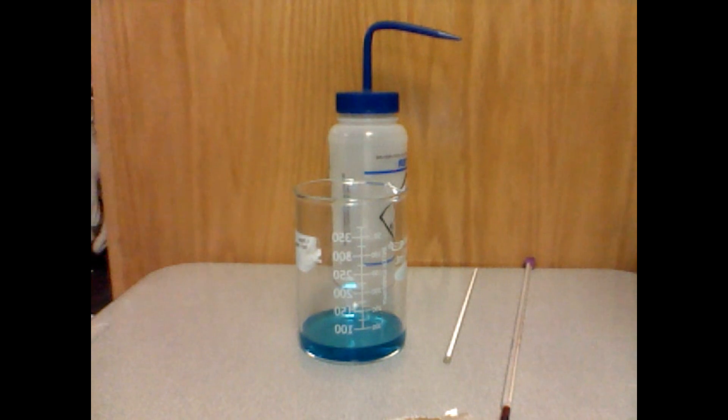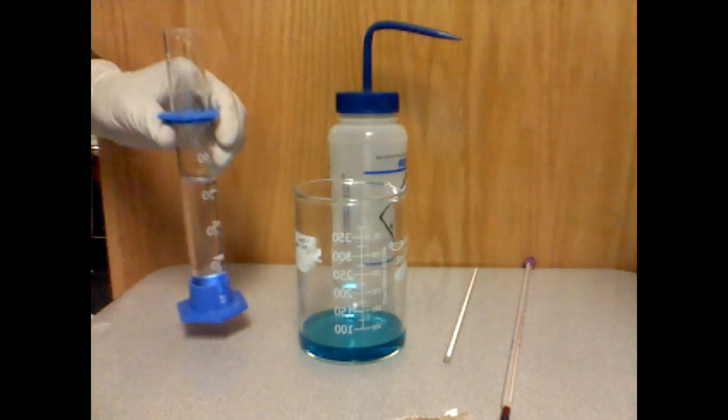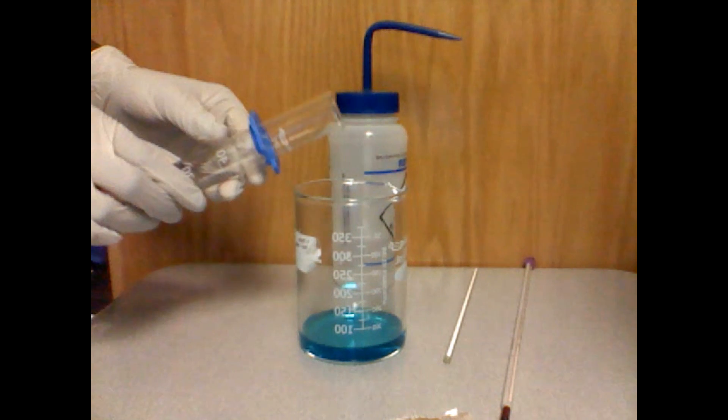Next, we will measure 35 milliliters of water and add this to the copper(II) chloride solution.